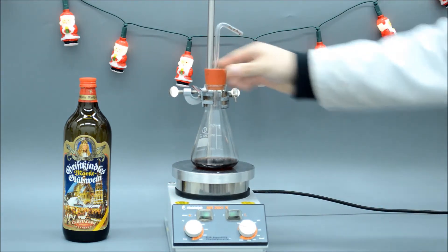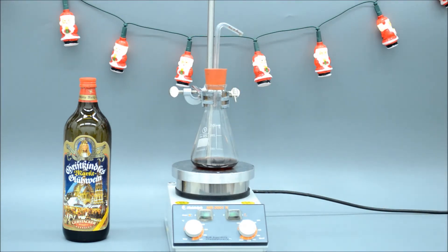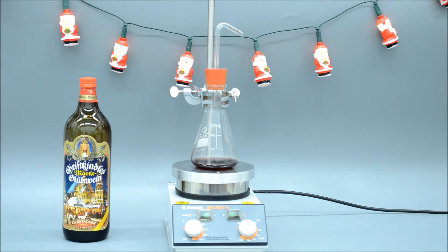We heat the contents of the flask until the wine boils. You can observe vapour rising into the glass tube, where it condenses again immediately.